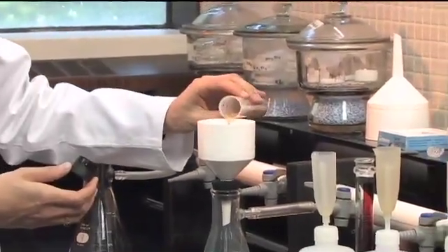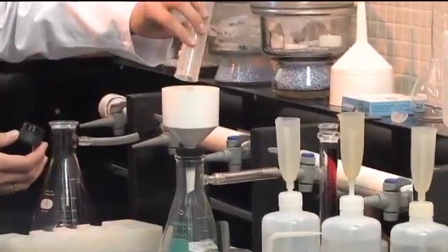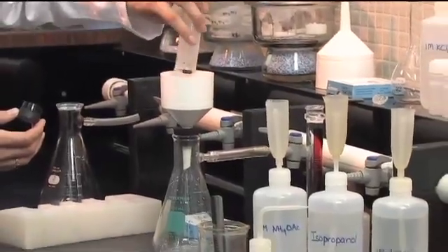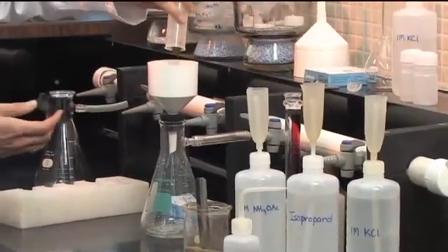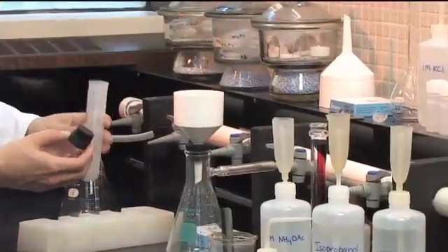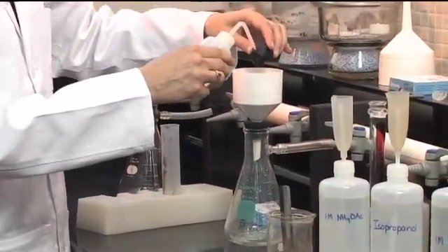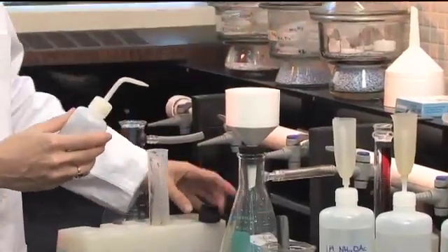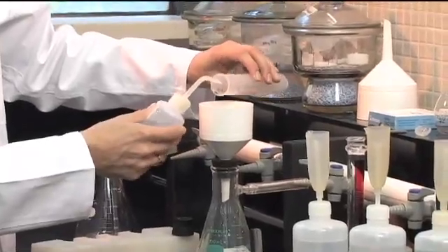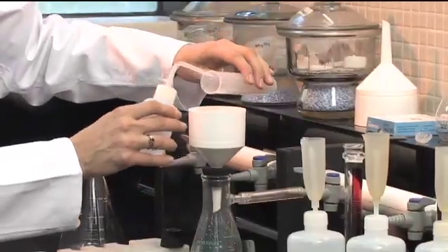Pour in our sample. What's happened with this first extraction is that the ammonium ion from the ammonium acetate has replaced all of the cations that were originally on the exchange sites. What should be coming out — because it's been displaced into the solution — is our calcium, potassium, and magnesium ions. Give a little rinse of the stopper and rinse out the tube to make sure we get all of our soil sample, because we're going to be further extracting and rinsing the sample.